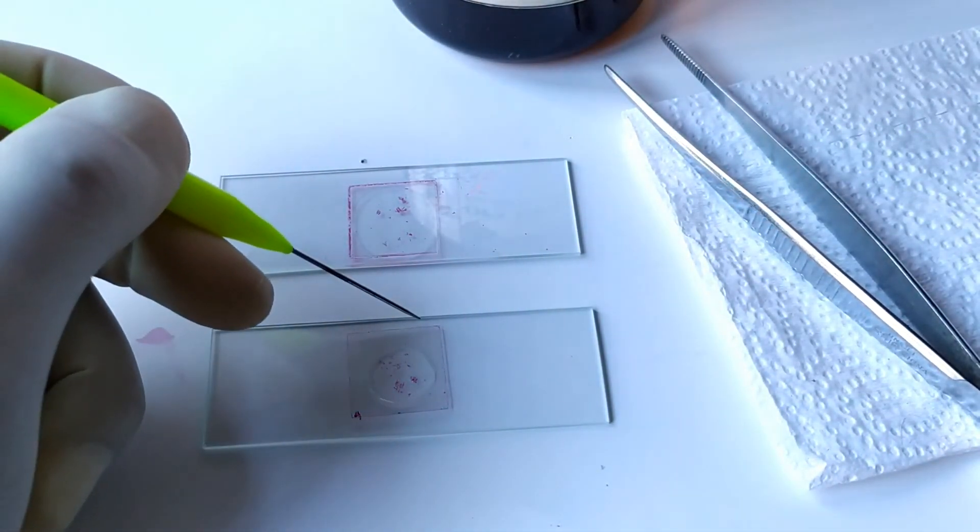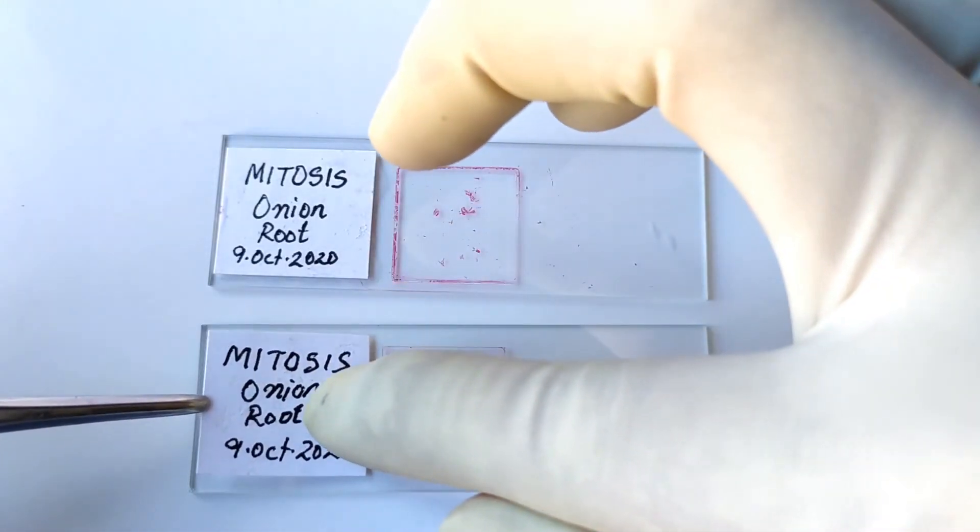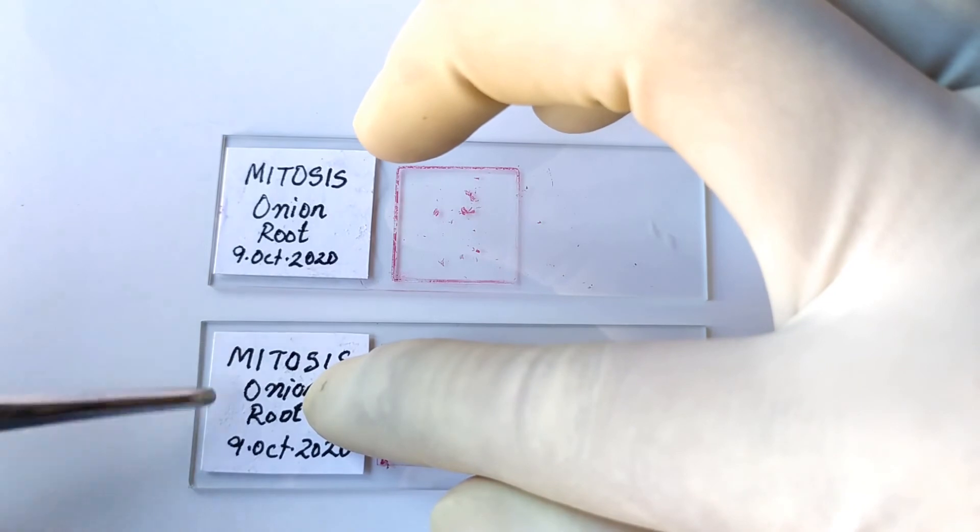Attach appropriate labels to the slides and allow the mounting medium to air dry overnight.